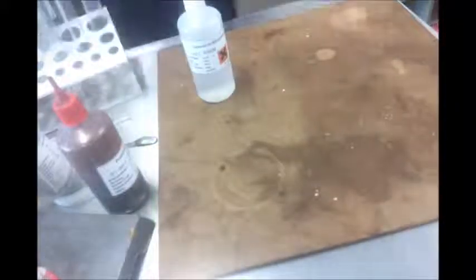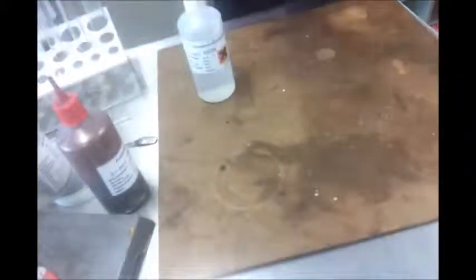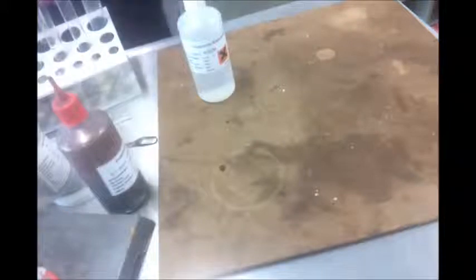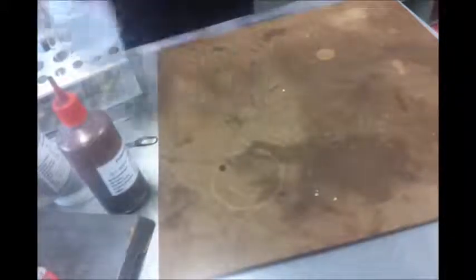Okay. Now let's go back to my good friend the iron and the acid. And you can see it's bubbling a lot more now. Just took a little bit of time to get started. Okay. So what I want to do is check what that's turning into, because it could be turning into iron 2+, or it could be turning all the way into iron 3+.